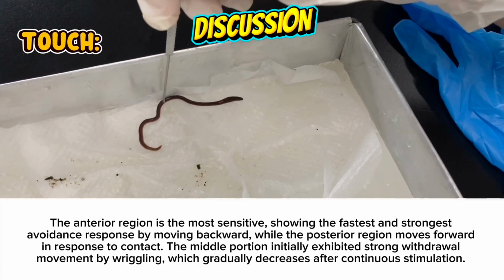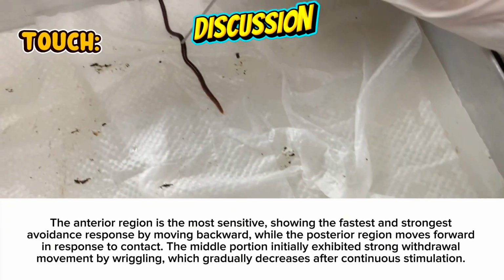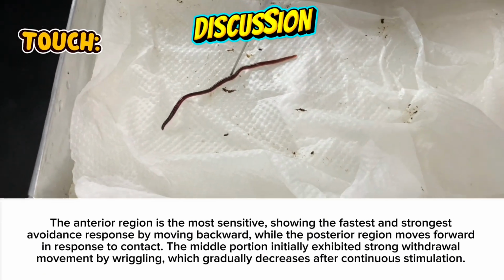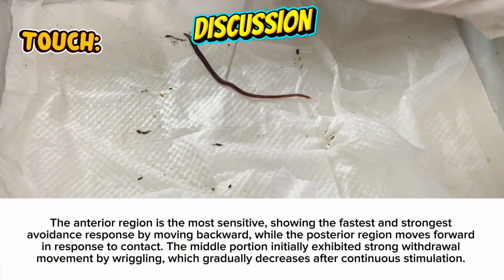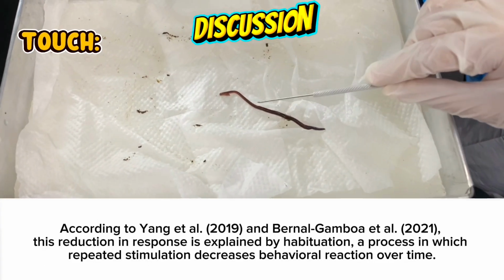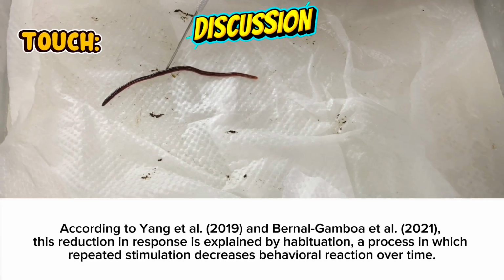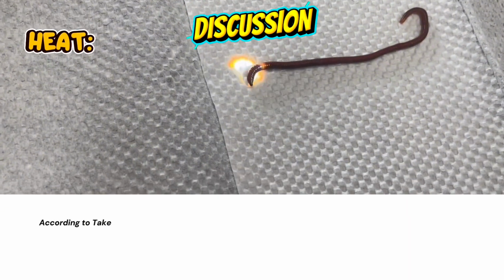The anterior region is the most sensitive, showing the fastest and strongest avoidance response by moving backward, while the posterior region moves forward in response to contact. The middle portion initially exhibited strong withdrawal movement by wriggling, which gradually decreases after continuous stimulation. According to Yang et al. and Bernal Gamboa et al., this reduction in response is explained by habituation, a process in which repeated stimulation decreases behavioral reaction over time.